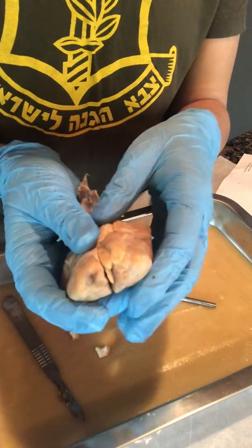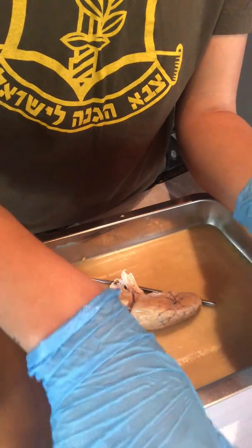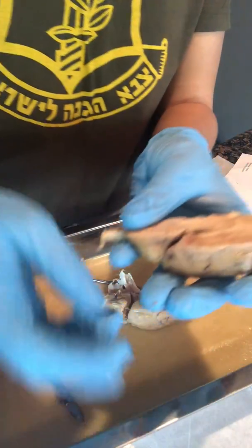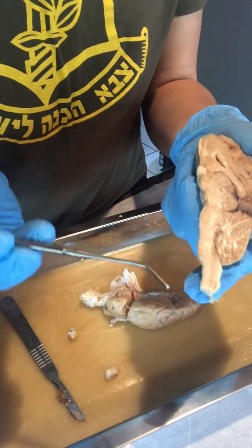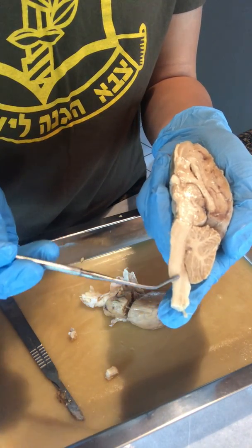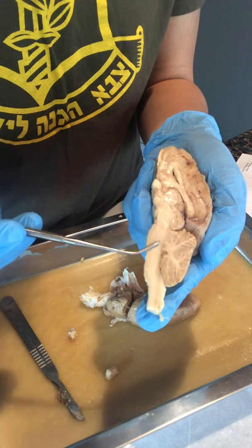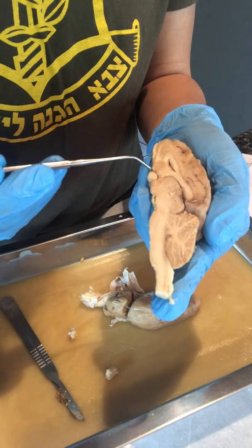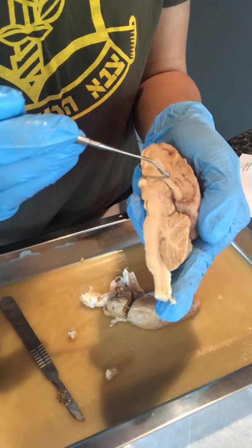And then if I split this in half, let's see, we would have our spinal cord all the way at the end, followed by our medulla oblongata, and then our pons, our midbrain section, with our pituitary gland, and our hypothalamus would be, I suppose, right here, and our thalamus up here.